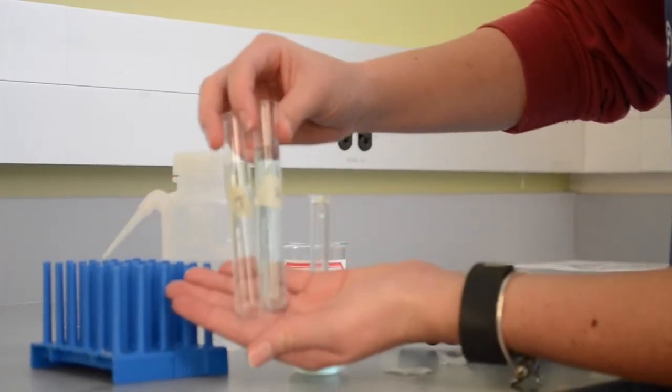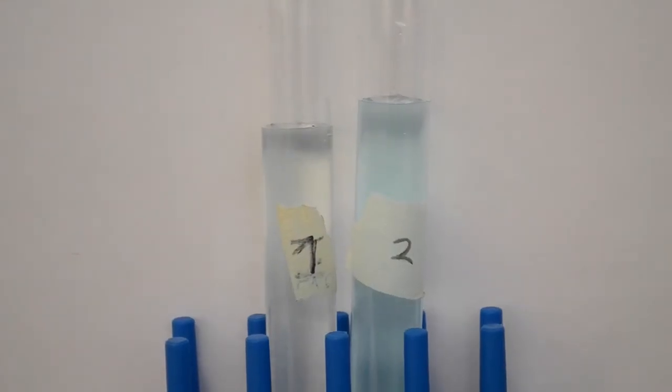The dilutions are made and you can clearly tell a color difference. Solution two is more concentrated than solution one.